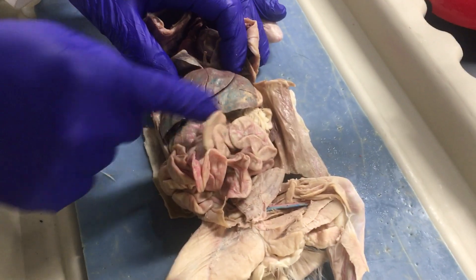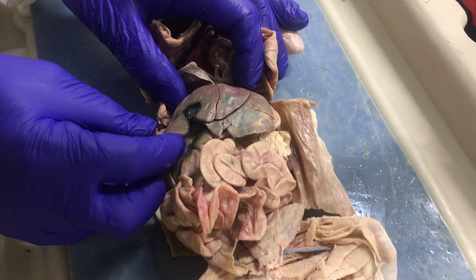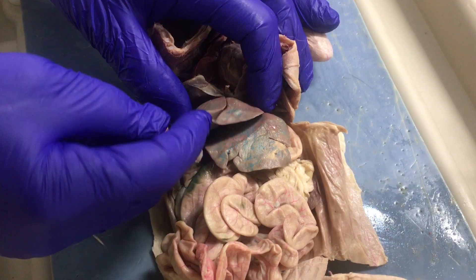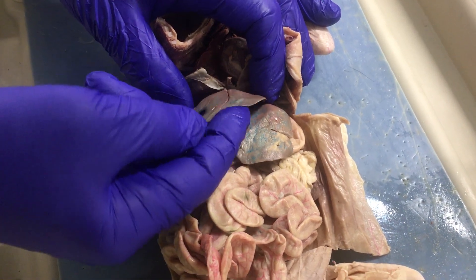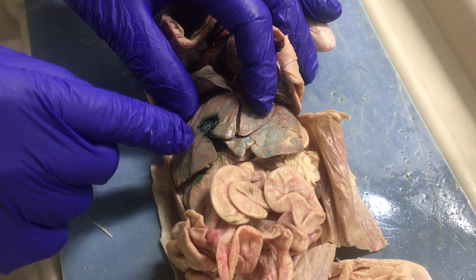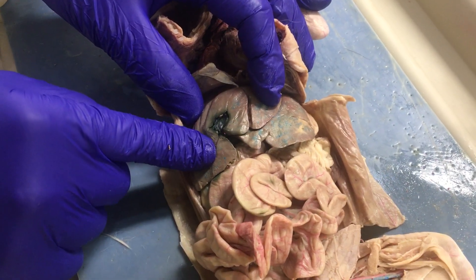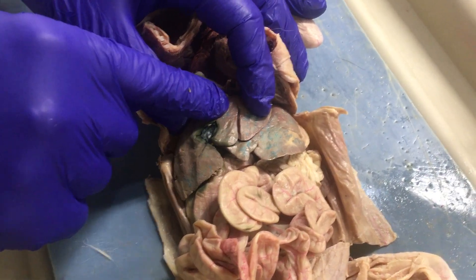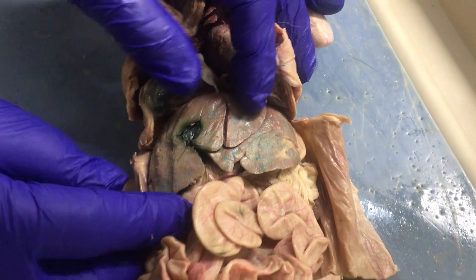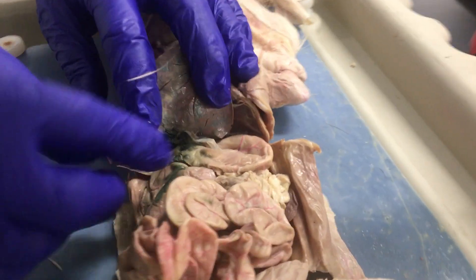So here's the liver. Right lateral, right medial, left medial, left lateral lobes. The gallbladder is here between the right lateral and the right medial lobes. So those are the structures there in the liver.